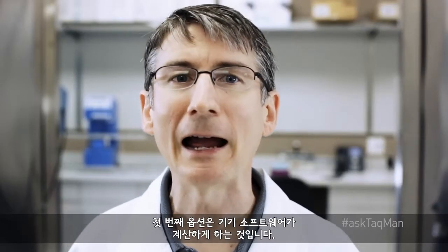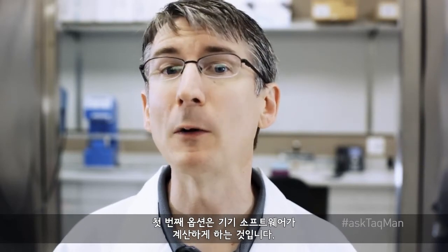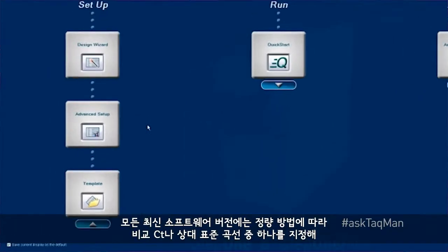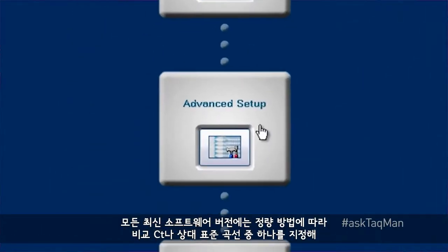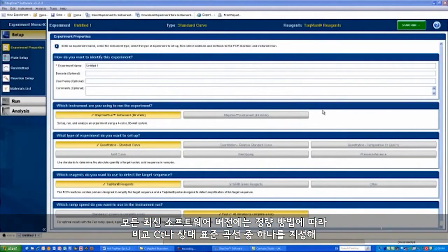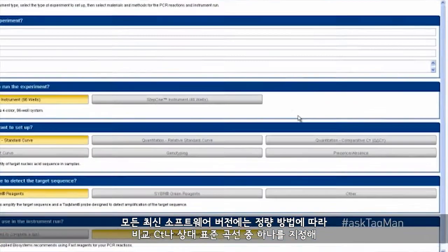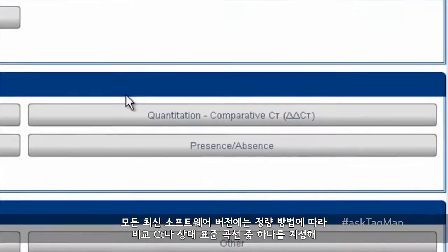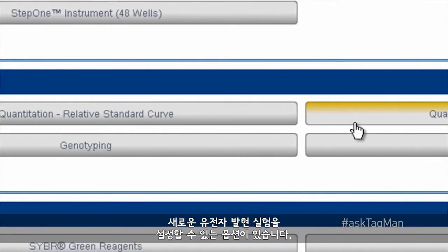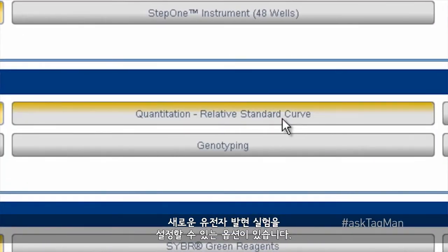The first option is to have the instrument software perform calculations for you. In all our most recent software versions, you have the option to set up new gene expression experiments by either designating comparative CT or relative standard curve as your quantification method.